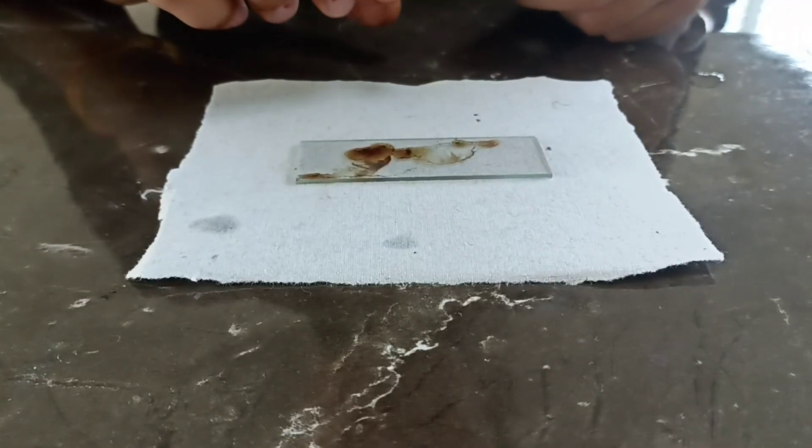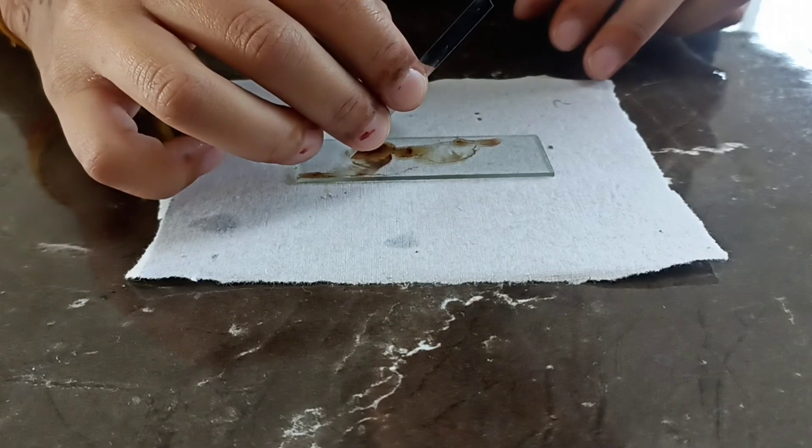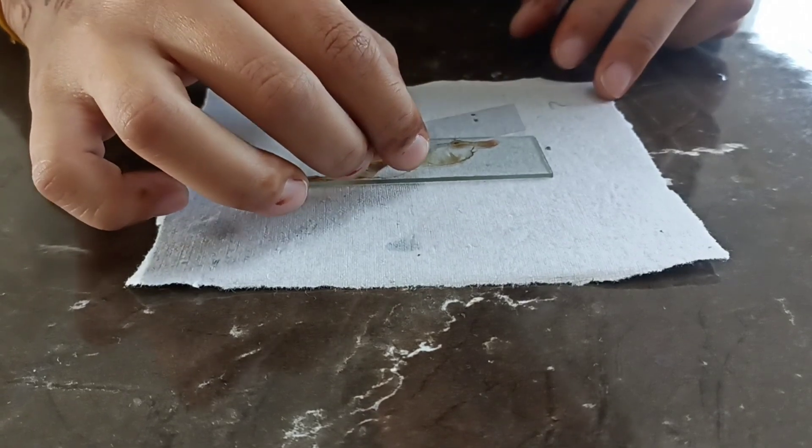Now, after mounting with DPX, cover the slide with a cover slip and observe it under the microscope.